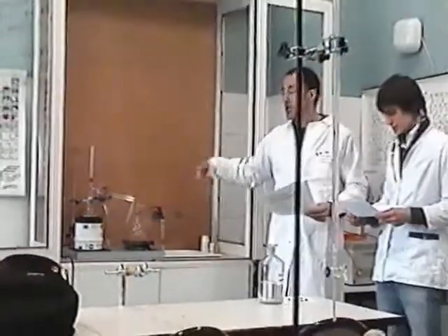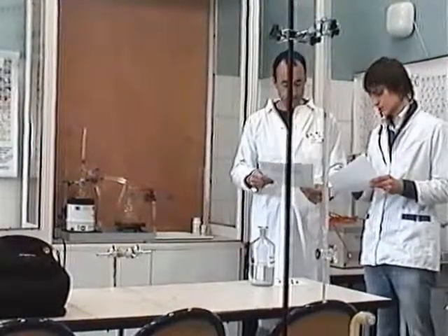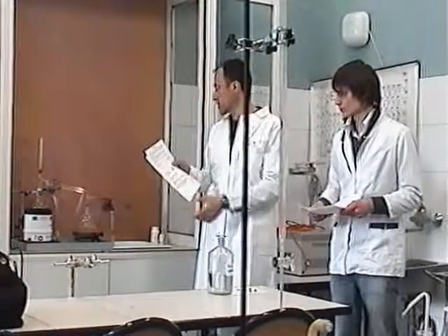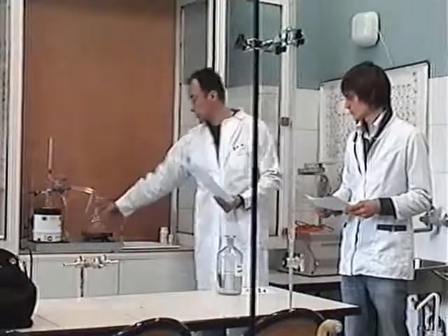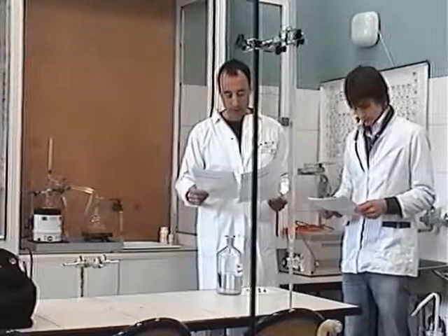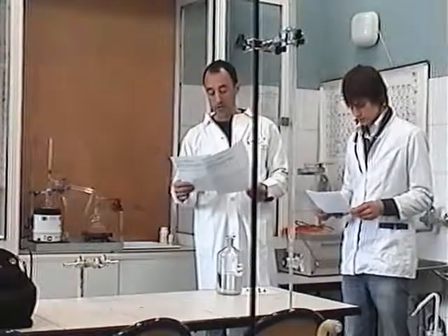It will take about half an hour. Now we have to make the second manipulation: determination of chloride ion concentration by titration. I forgot one caption you have to write — it will distillate into the receiving glass of the container, which is here. Now we make the second manipulation.